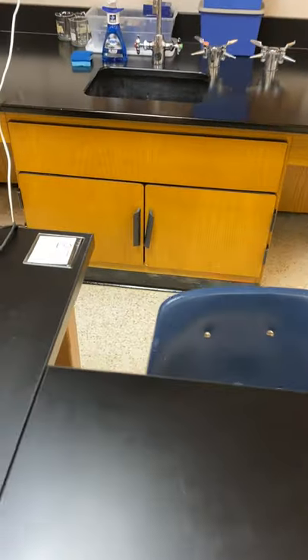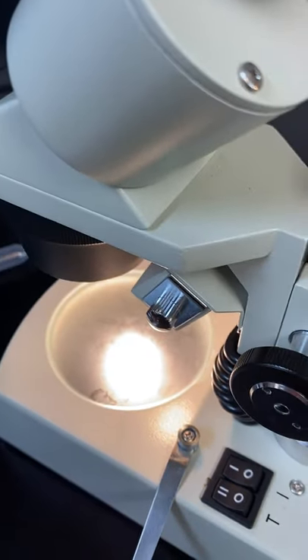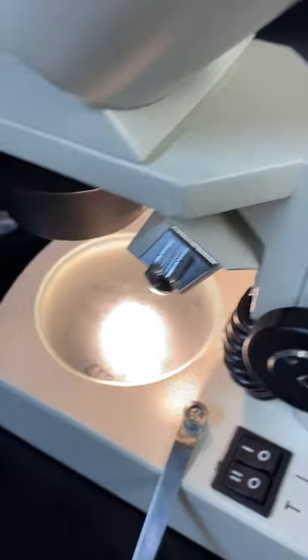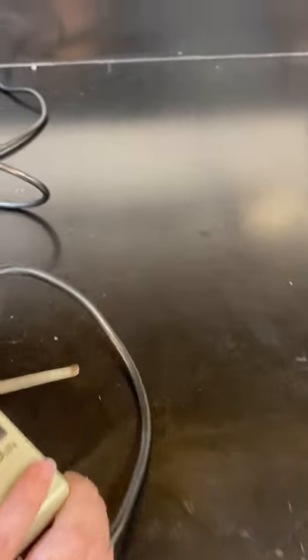Here is day three — let me pull out one of the petri dishes. I'll show you what it looks like for day three for people at home. On day three, we do have some new tissue growth. New tissue growth will look very clear and transparent.